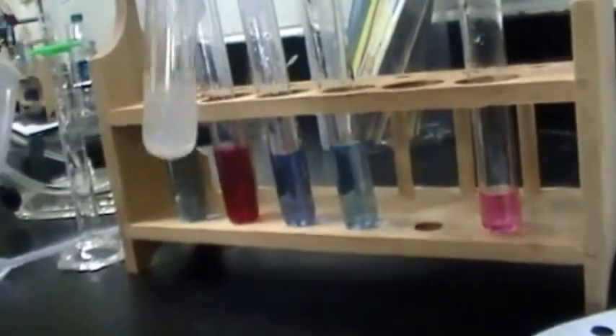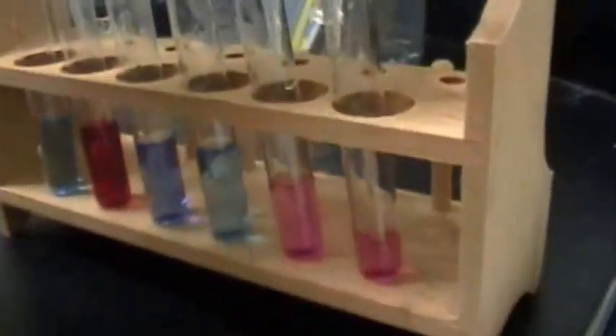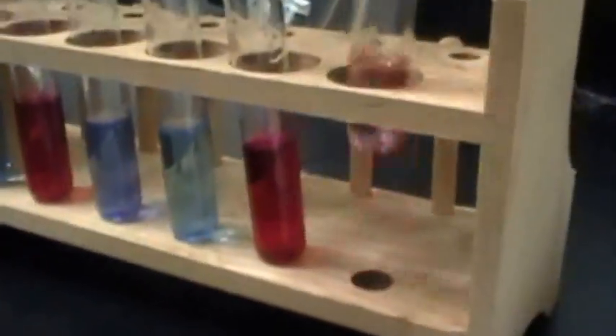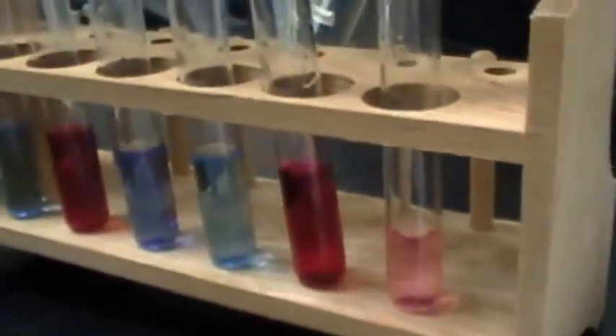The pink disappeared. So now we're going to take a pause and get more sodium hydroxide. Third drop in — this one gets really dark. One drop. It just got lighter — it's the same color though. It started off pink. Did you write it started off pink?